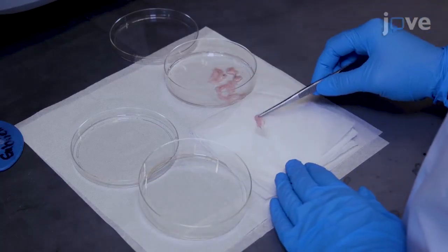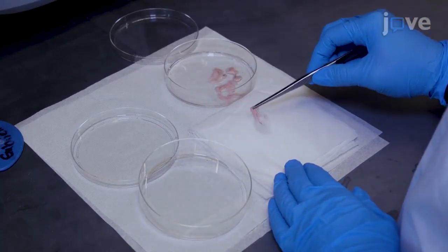After collecting adipose tissue from mice, pat it dry with a paper towel and place it in a clean dish.